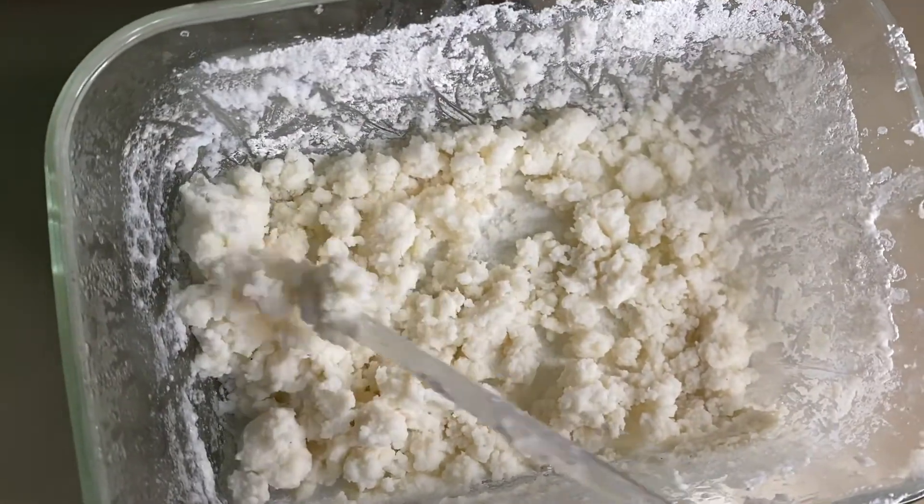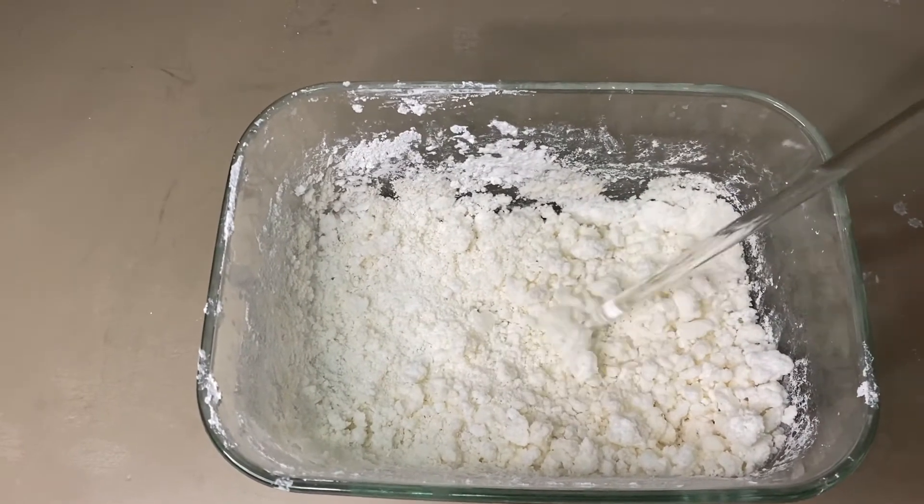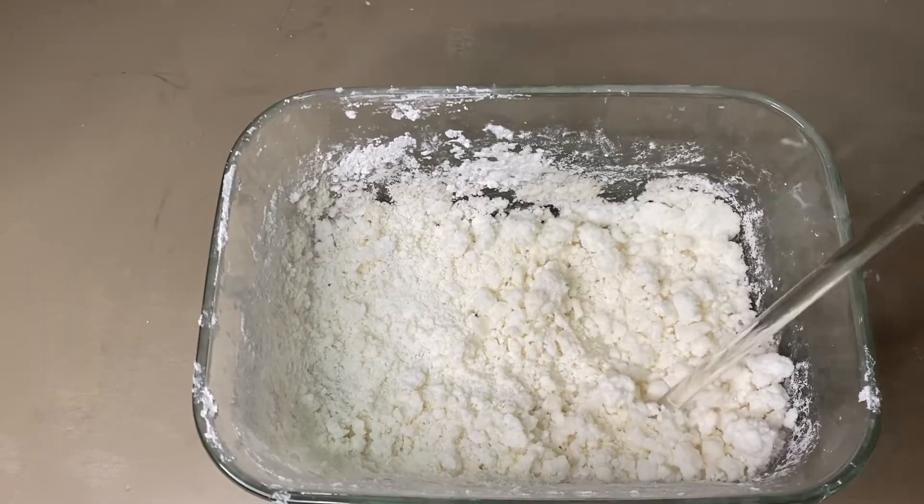It's still a bit wet, so we decided to put it in the oven to make sure that the salt we collected was all anhydrous.